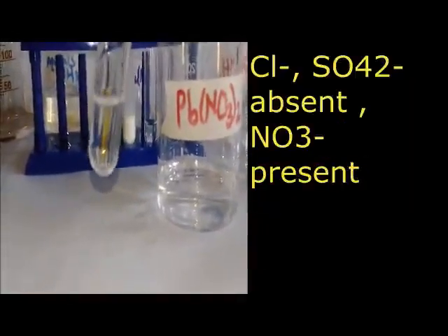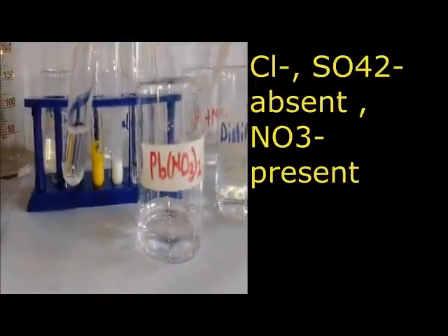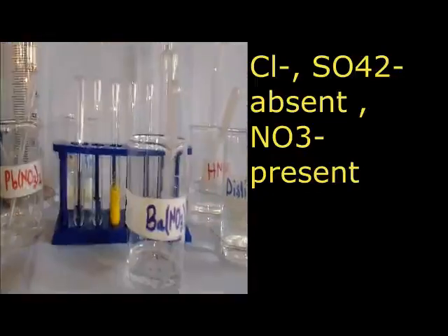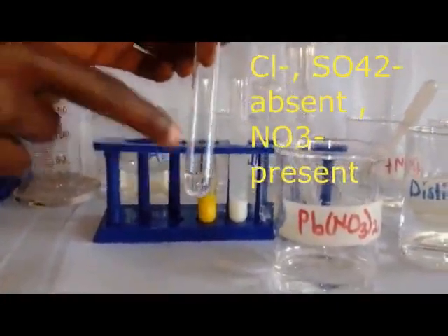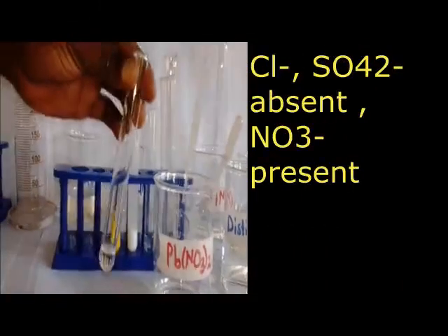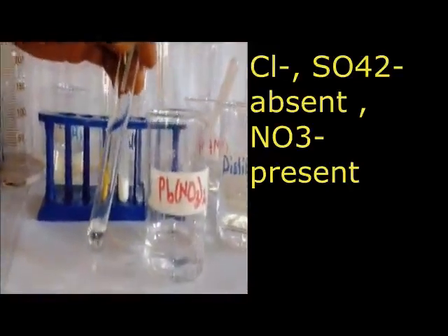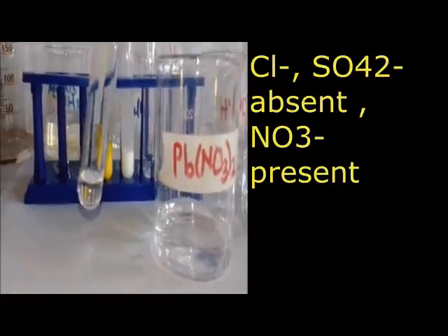But now that I'm adding it, things remain unchanged. So in my conclusion I'm going to tell the teacher that sulfate and chloride are absent. Then I put there nitrate present. So we are saying sulfate, chloride, and carbonate absent.